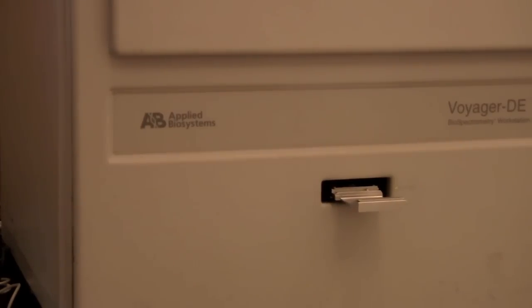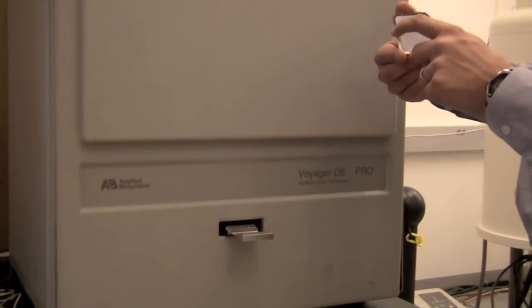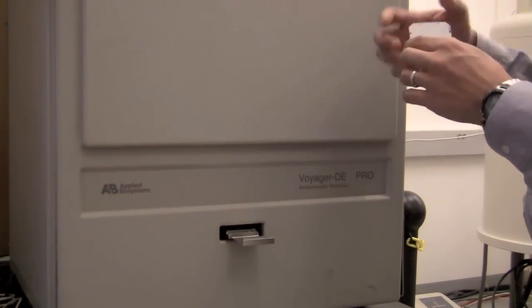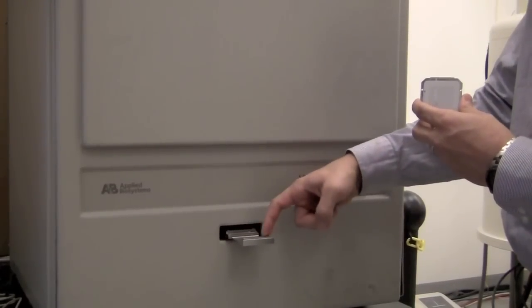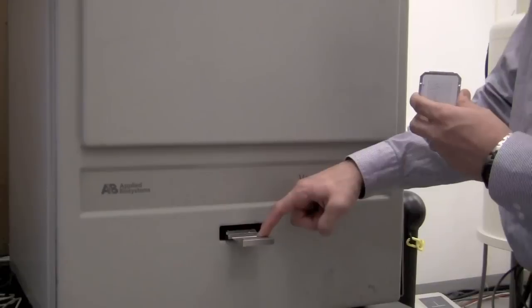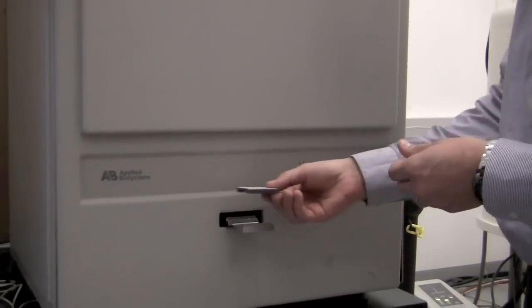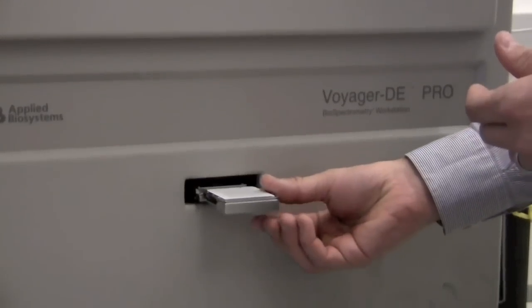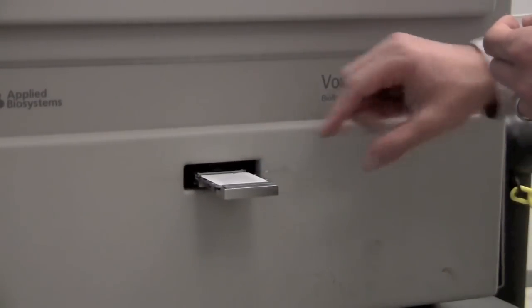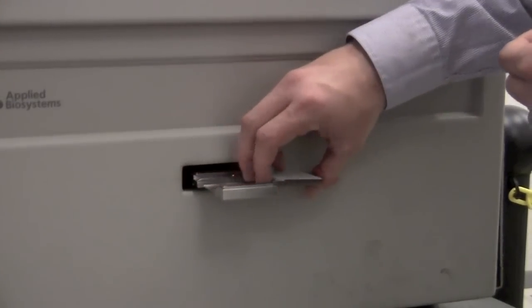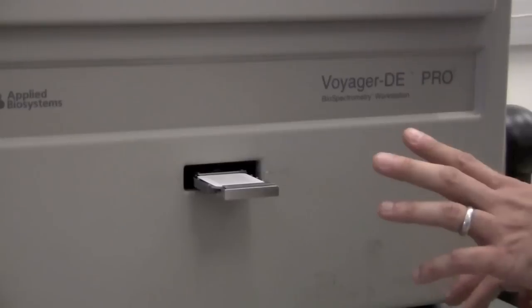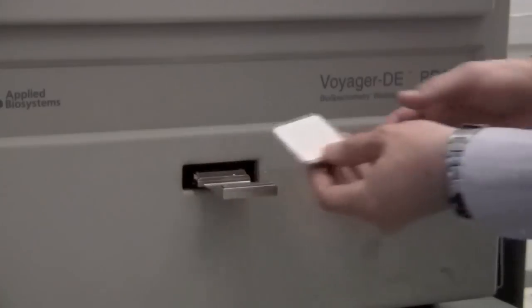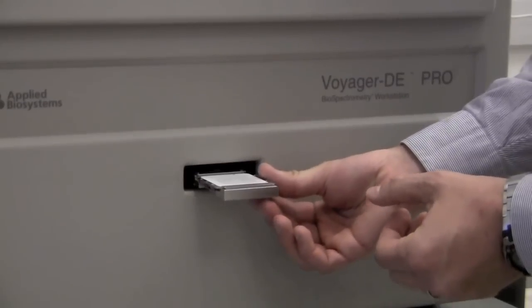Now it's critical that you load your sample plate correctly into the system. The sample plate has a couple of holes here, and these holes need to engage with some little balls with the spring behind them to hold the plate into place. So we need to load it from this side, and it should slide in until it clicks, and there it's in the right place. If it's too far out this way or if you try to load it the wrong direction, it will cause problems. It needs to be loaded the right way, and it needs to be pushed in until it clicks.